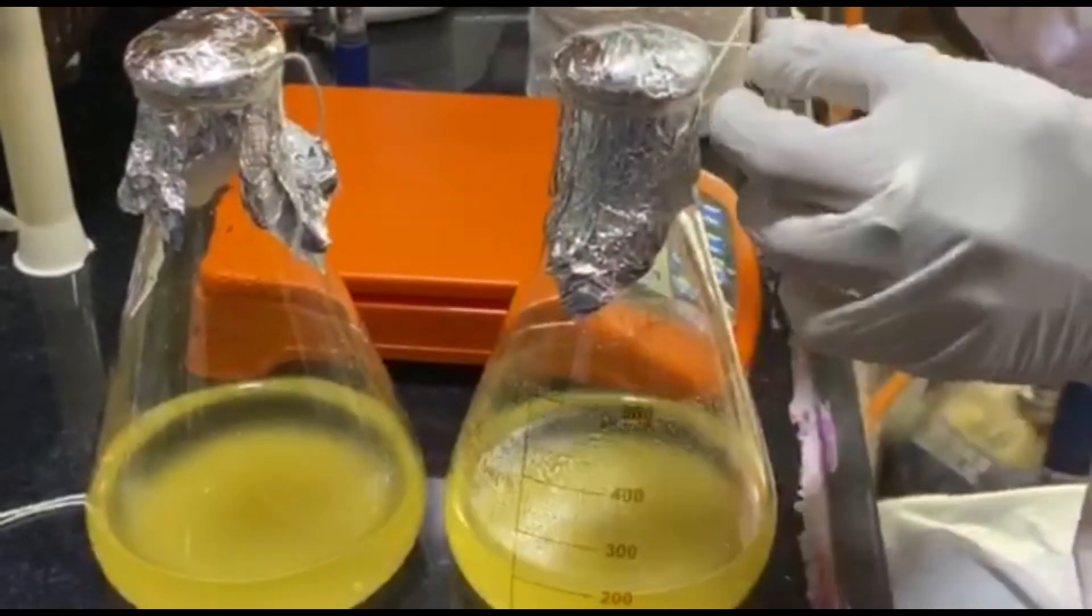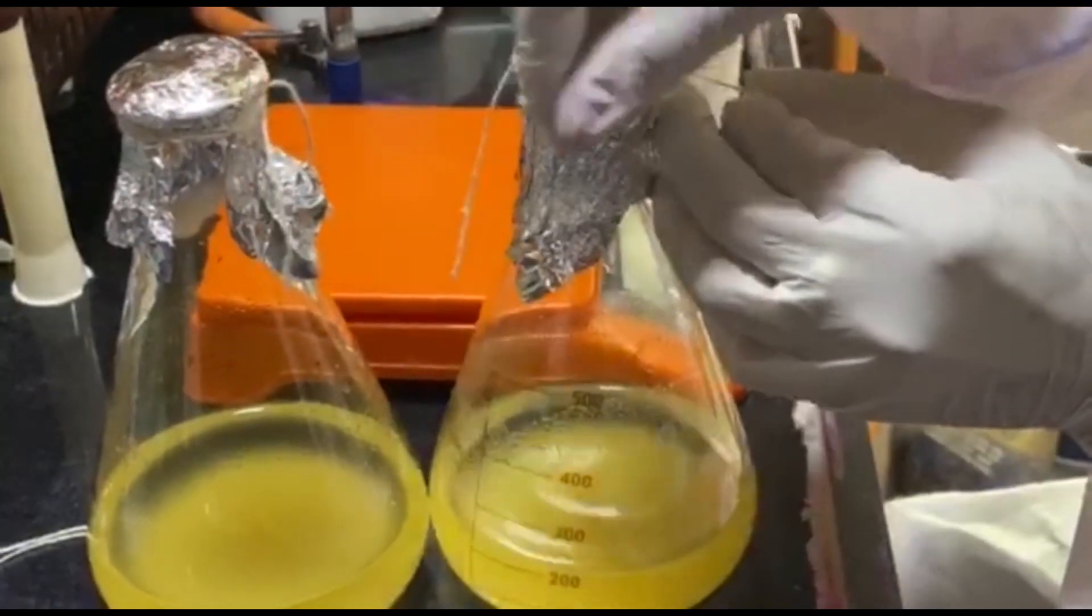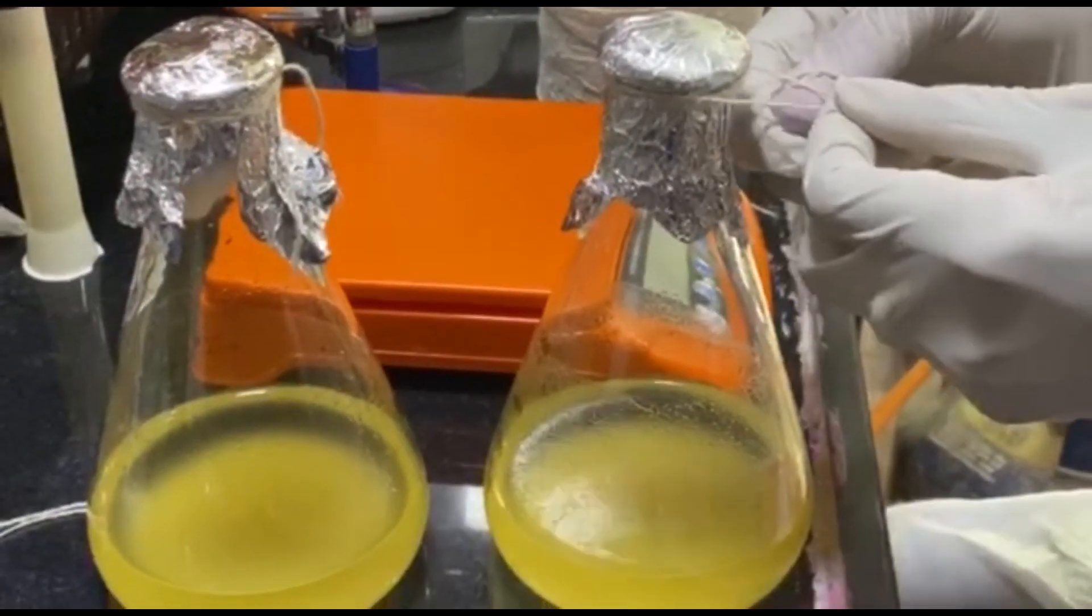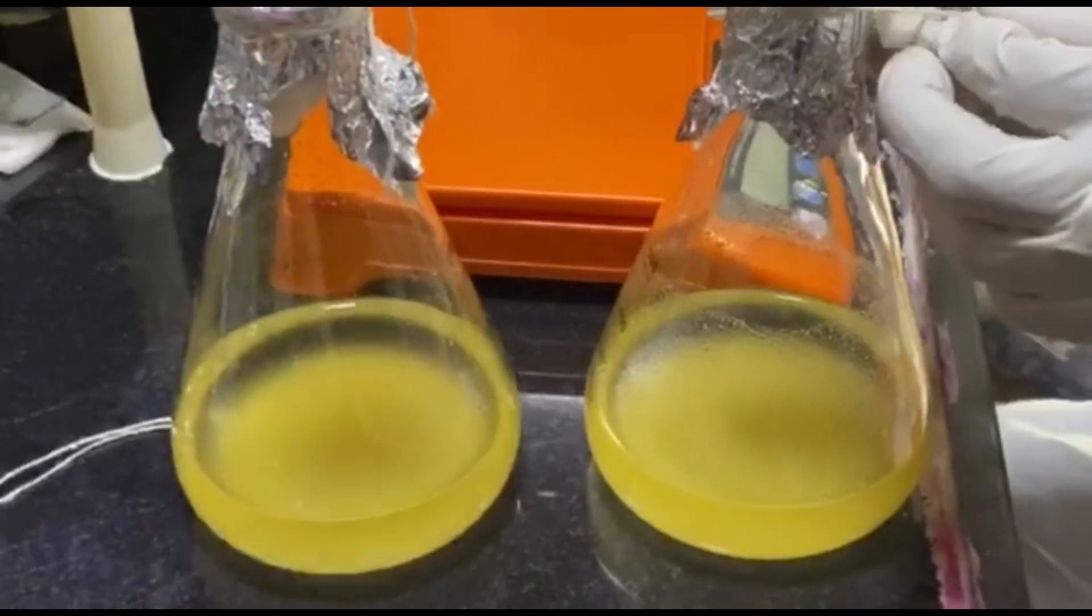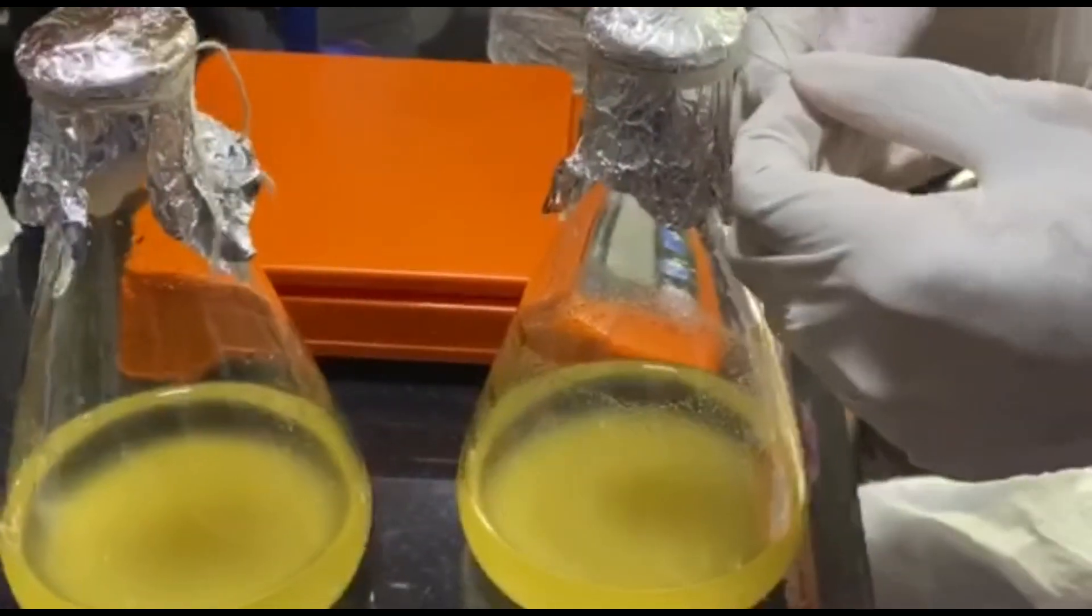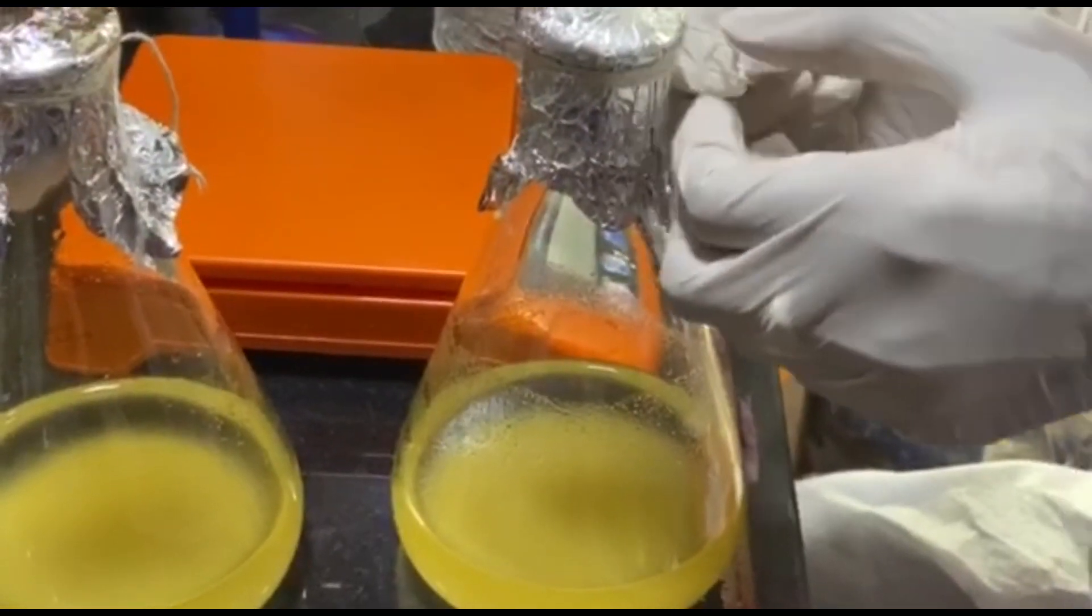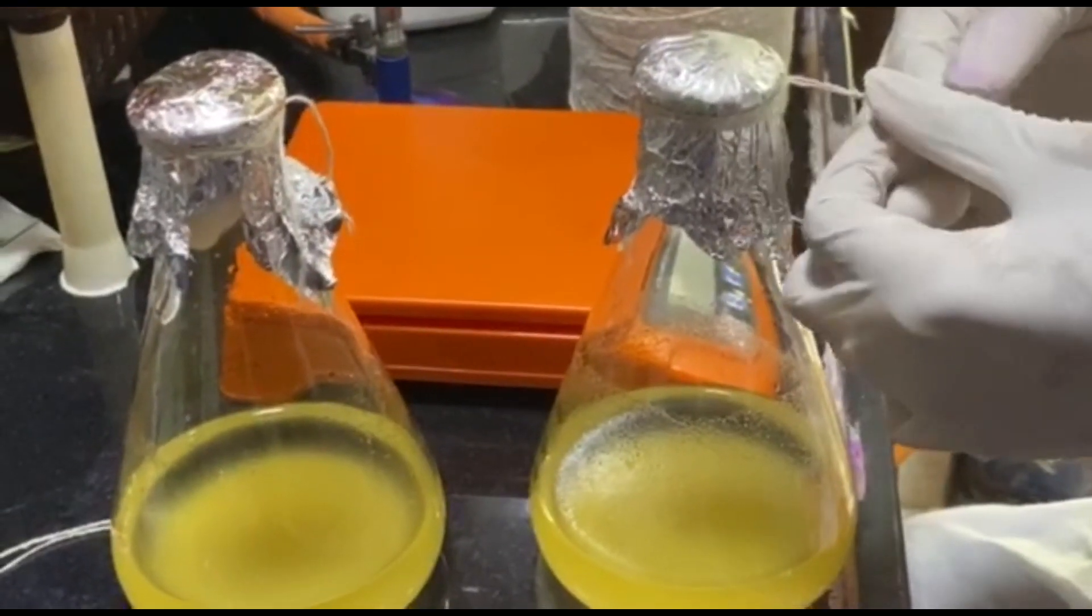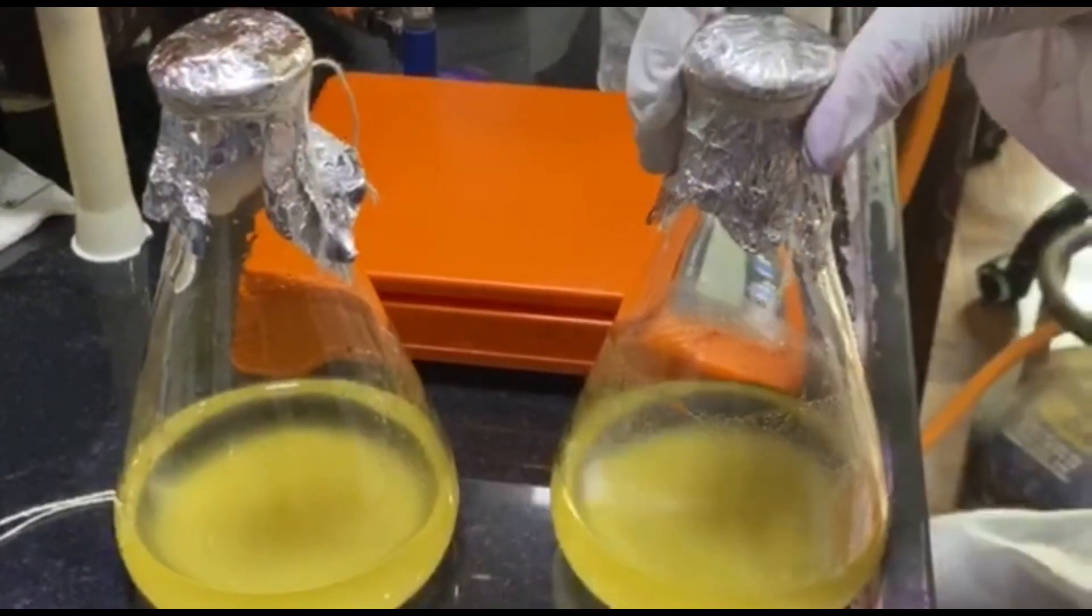As I said, we are going to use nutrient agar as base, and then on top of that a layer of nutrient agar mixed with blood. It sounds a little complex but let me show you how easy it is. Here we have the flask for the base - 200 ml distilled water mixed with the appropriate amount that we calculated of the powder. Similarly in this flask we are going to add blood that is 5%. After this step of tying the knots and securing the flask properly, we will start the autoclave and try to sterilize these flasks.